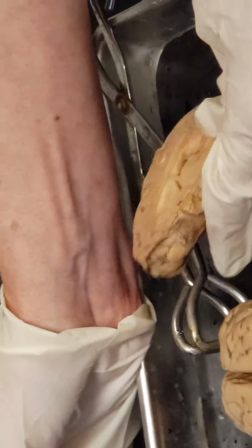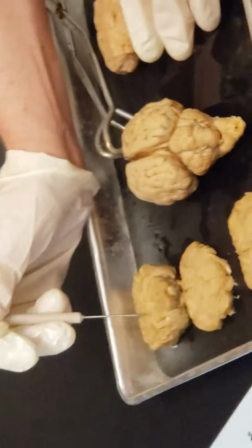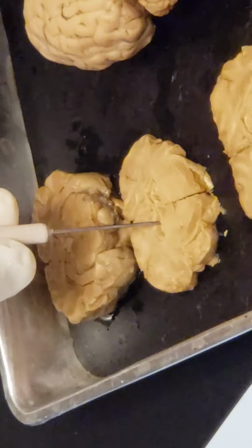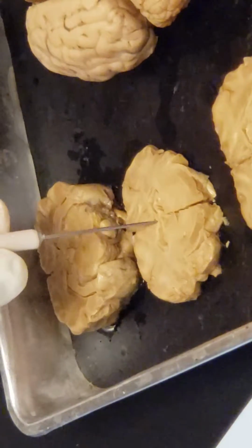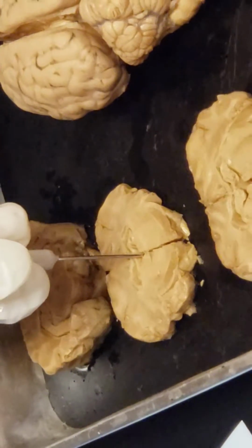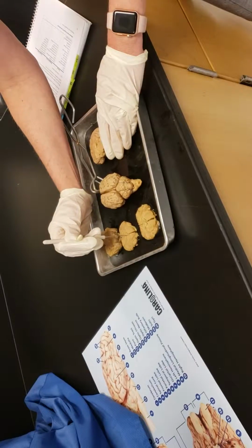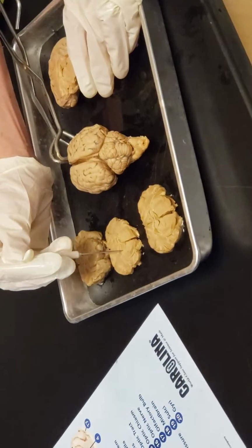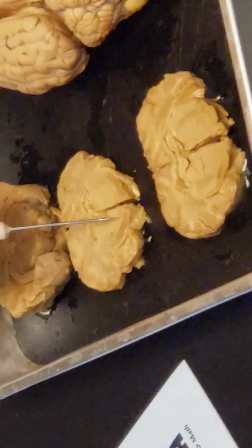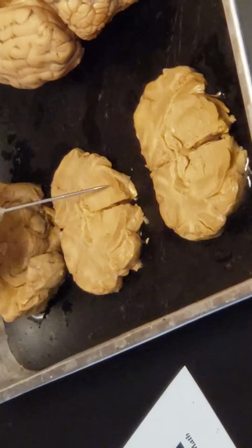If we look, I'm going to switch over here to the coronal section or frontal view. Here we have the lateral ventricles. This one opens up for me better. So here we have the lateral ventricles. We have the corpus callosum up above. We have the fornix down below. We have the 3rd ventricle here, and the intermediate mass would be whatever bridge or connection we see between the 2 sides of the thalamus. So this is the thalamus, and this is the thalamus. And the area that's just underneath the thalamus is hypo to the thalamus, or the hypothalamus. So this is the hypothalamus down here.